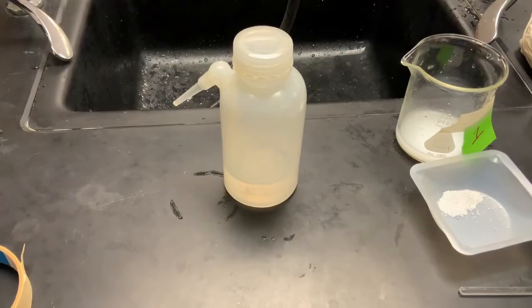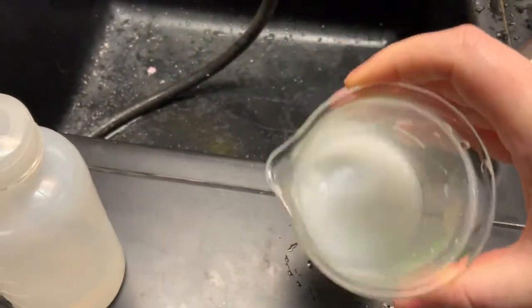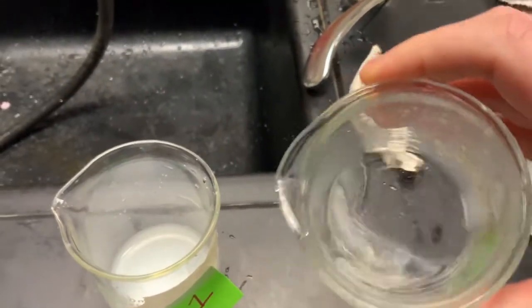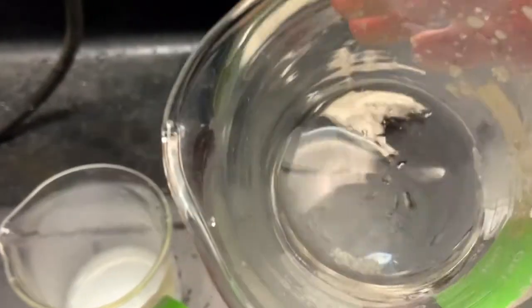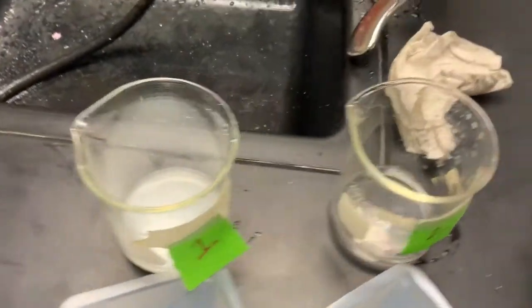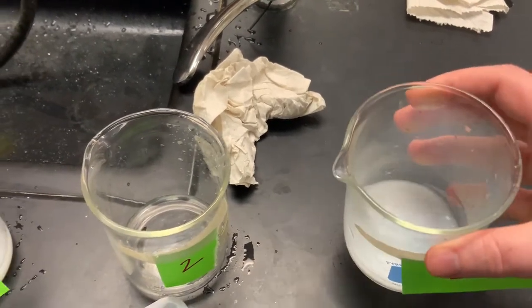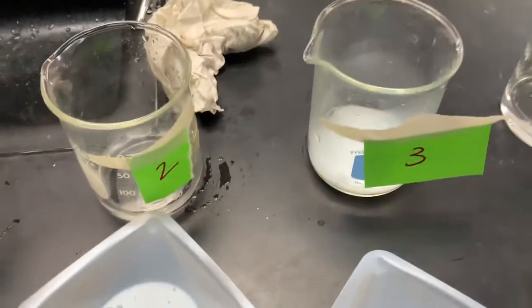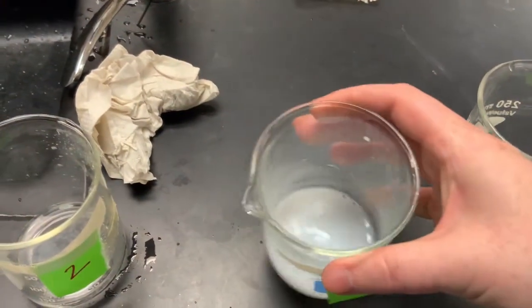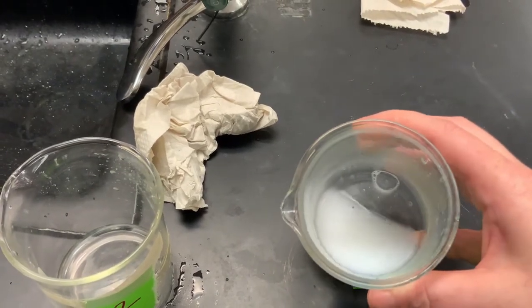Our last solubility test is for water. Here is sample one. Sample two — it appears to be slowly dissolving. Sample three was fizzing and got slightly warm; the bottom of the beaker is warm.